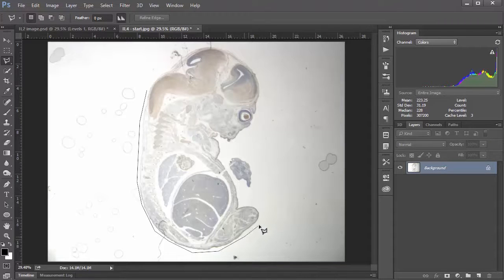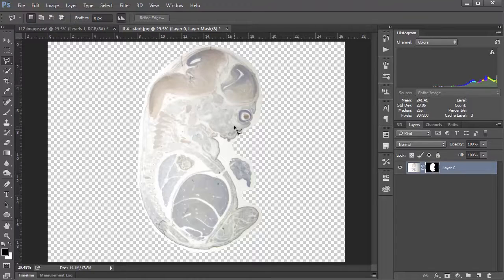I'm going to go kind of quickly here, because this is not the most exciting thing in the world to watch. Just around the little foot, up by the face, all around the river bend here, just like that, and like that, and there we go. Once we have our nice selection, we'll click the Layer Mask button to mask out all the other junk that we don't want anymore, and already that's starting to look a little bit better.